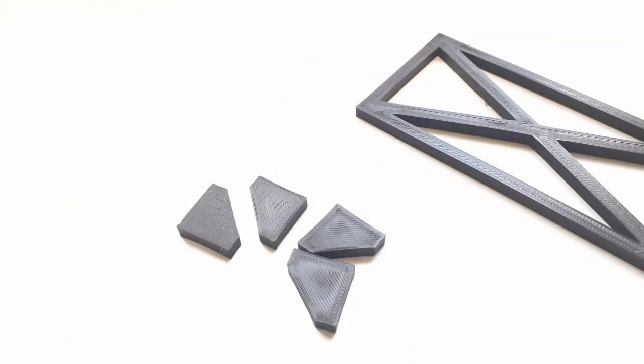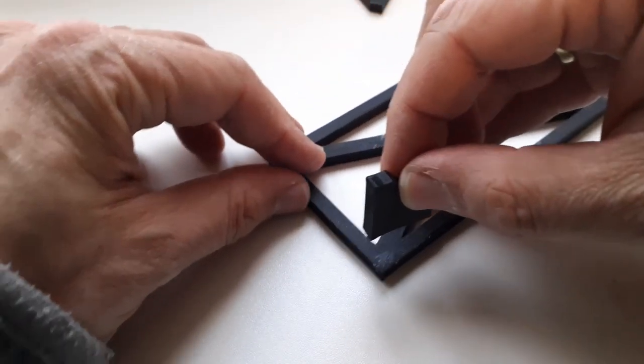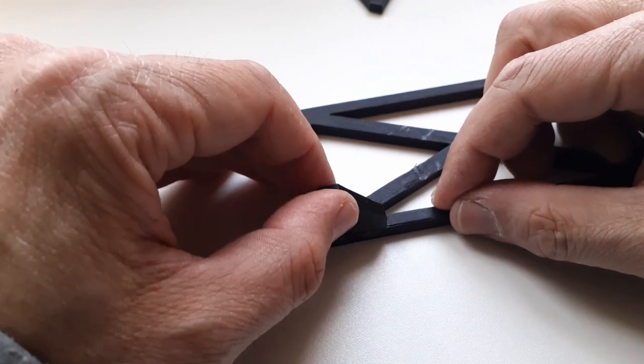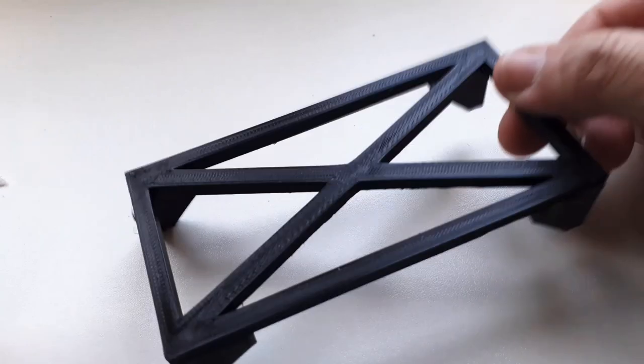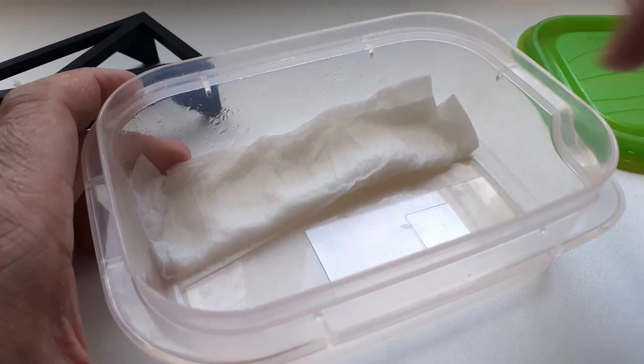Of course, I now had to use a glue gun to connect the four legs to the rack. I think it's not the most stable way of connecting it, but then again, there are no stresses and no loads on the rack, so it really should be fine. Yeah, so that's basically how it looks like, it's okay. In my view, it's perfectly useful.